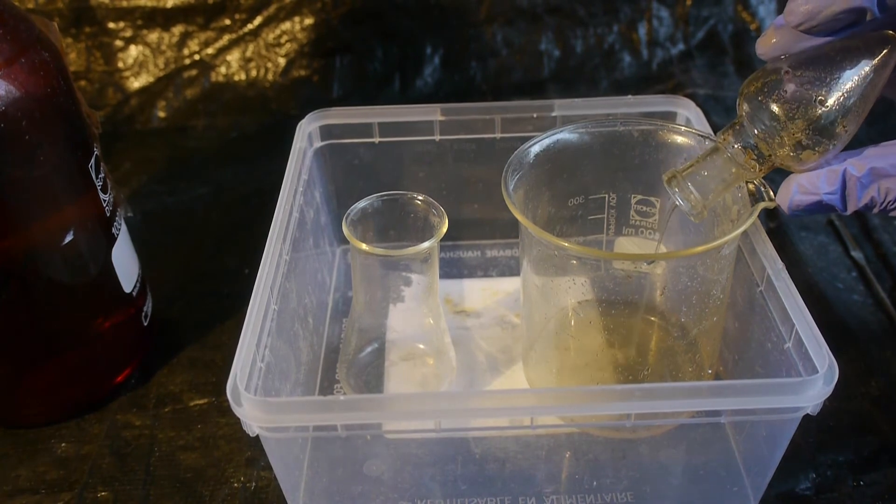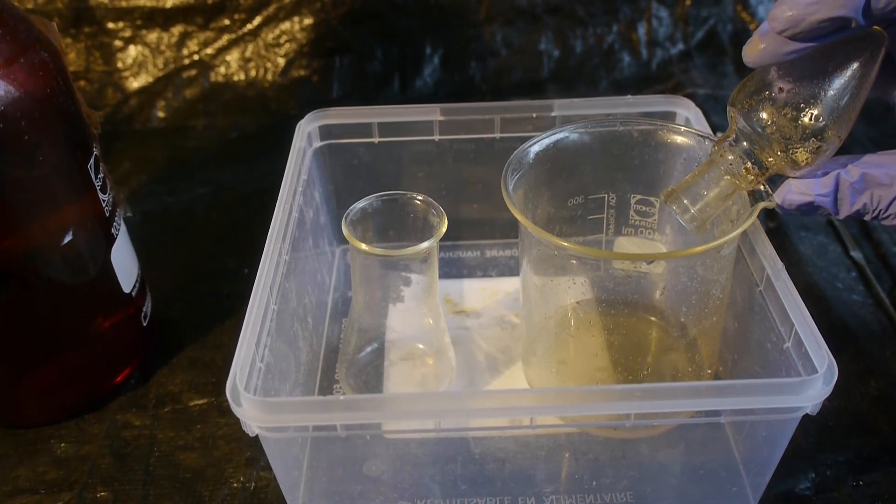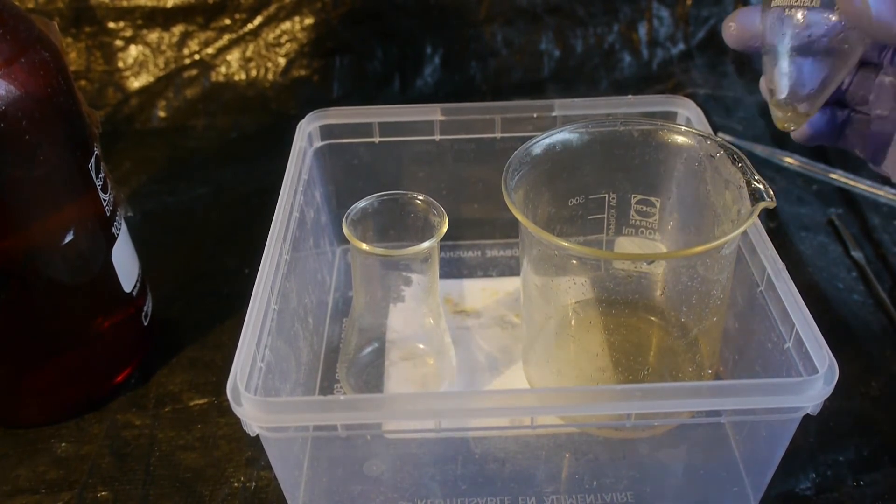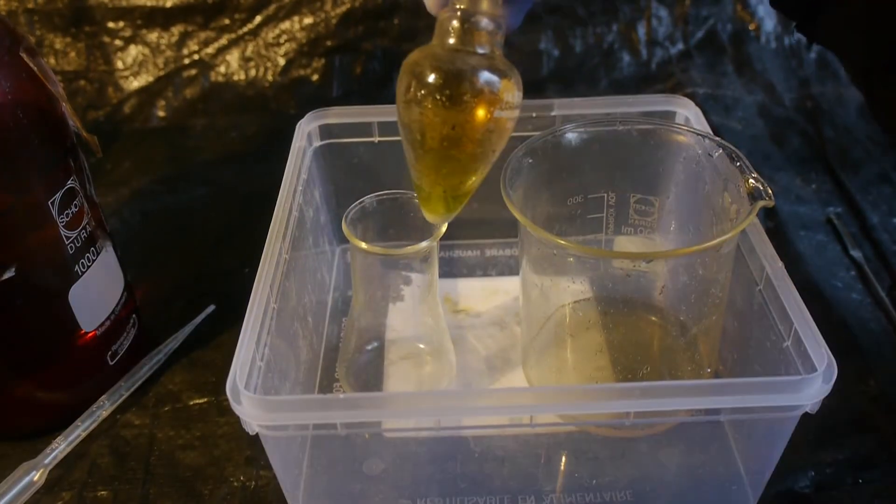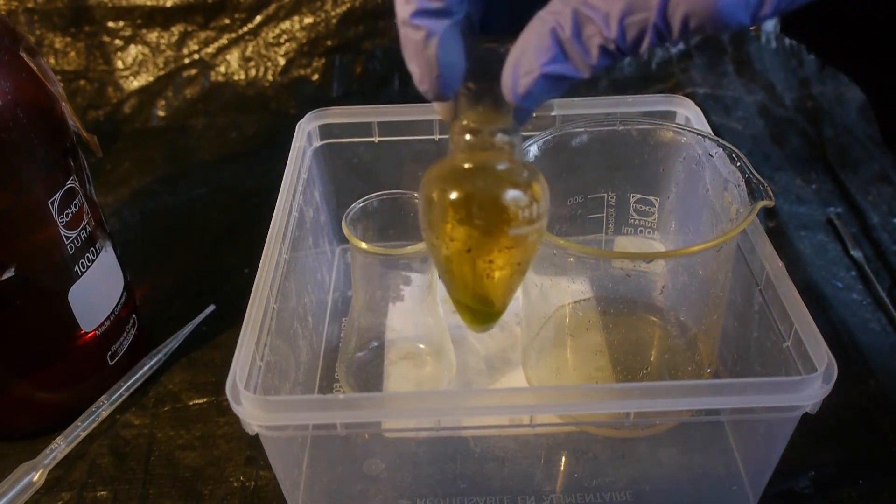Okay, so that was certainly not sand. Because it all dissolved in water. Which sand doesn't do. Let's try to dissolve the remaining mercury. Yeah, it forms exactly the same colored precipitate. Great. So now I have a bunch of dissolved mercury salts.